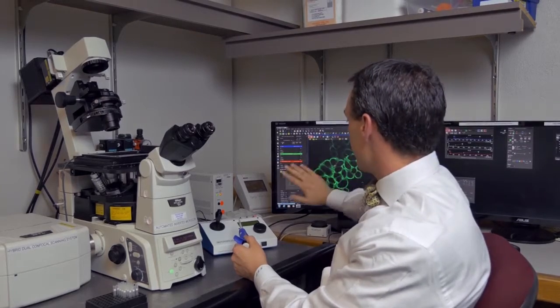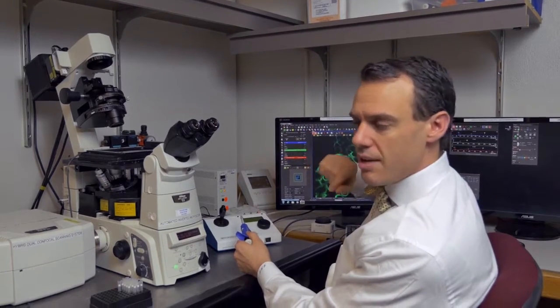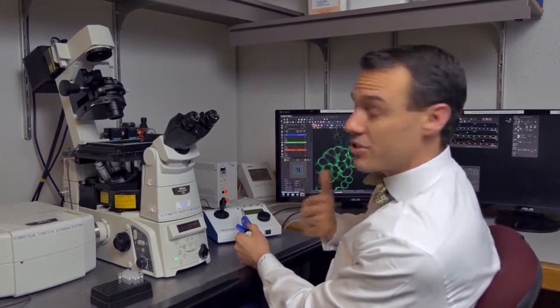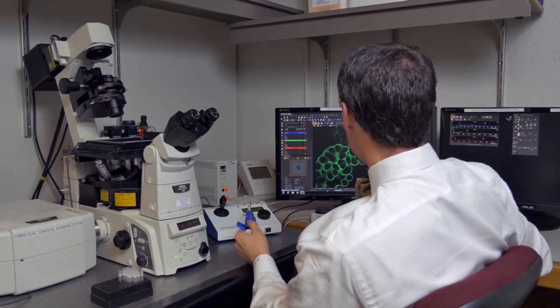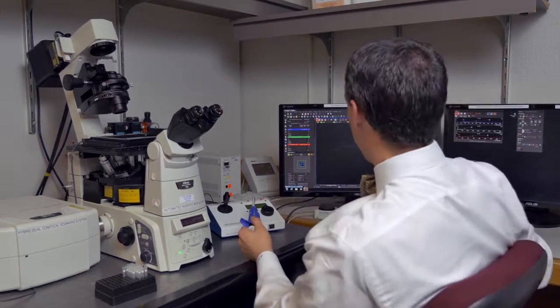Now we are taking just a section, so it's kind of like cutting a baseball in half. That's why you're not getting the full properties, the three-dimensional shape of the cell. That's part of the properties of a laser scanning microscope. And then if we go to the red, we can see that there's nothing. Red is indicative of the essential oils, which I have yet to add, and we'll be adding soon.